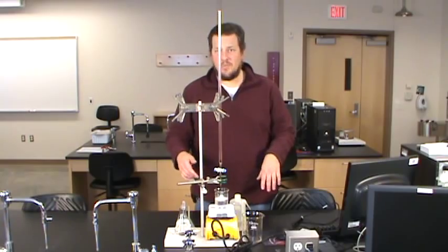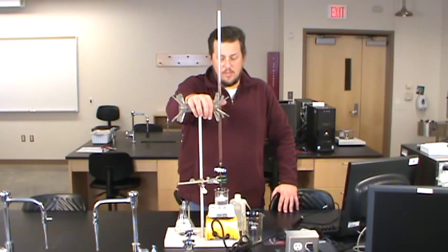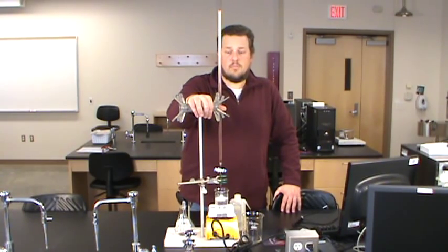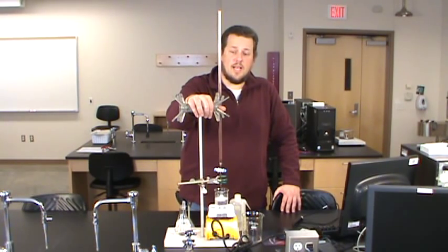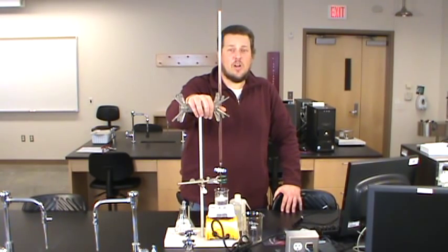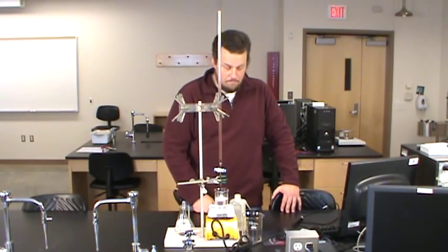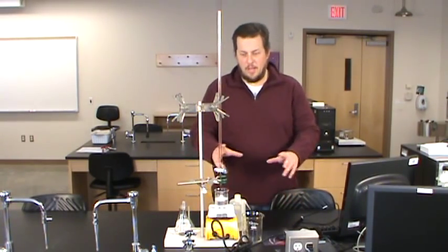This is our conductivity probe. The rest of the equipment for this experiment includes burettes. If you haven't used burettes before — and maybe even if you have — I would strongly encourage you to take a look at the other video online about how to properly use burettes. A lot of people use burettes but don't always use them properly, so make sure you take a look at that.